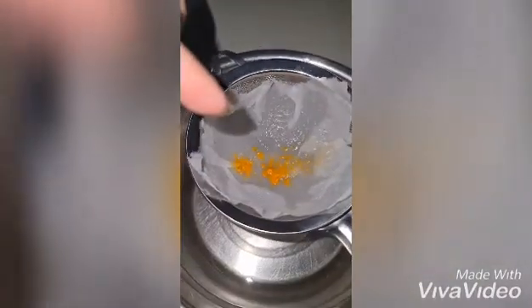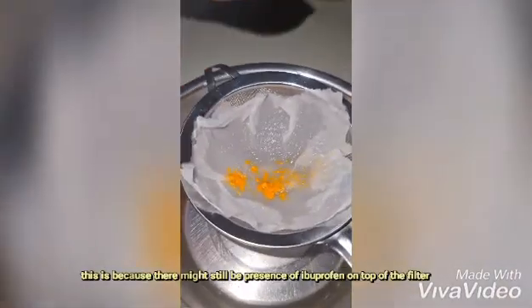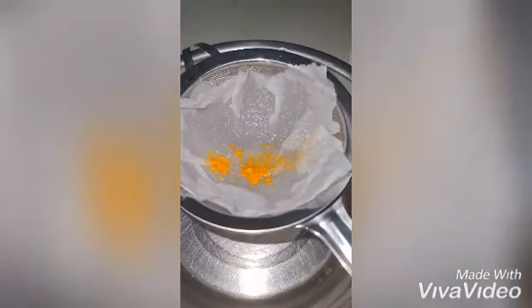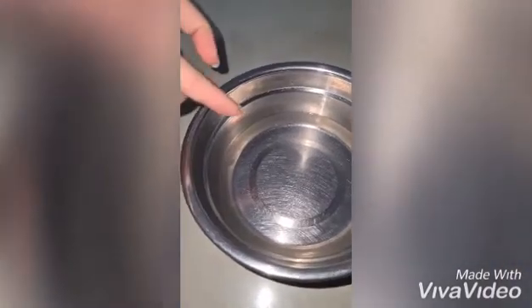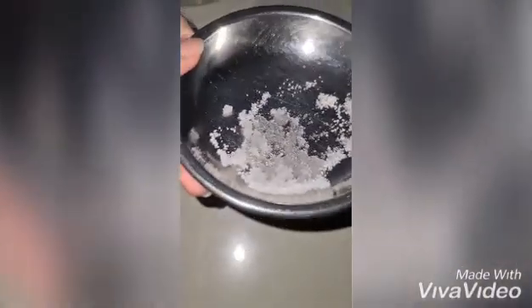In order to increase the ibuprofen yield, I'll have to add the hexane solvent onto this filtered undissolved solid again, and repeat the filtering steps as before. After the filtering process is done, this is the filtrate that I've obtained. After evaporation, these will be the ibuprofen crystals that you obtain. Thank you.